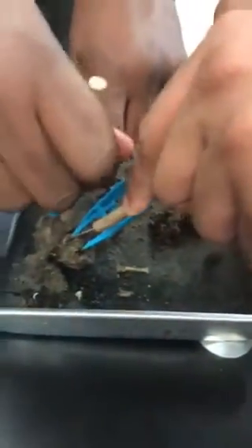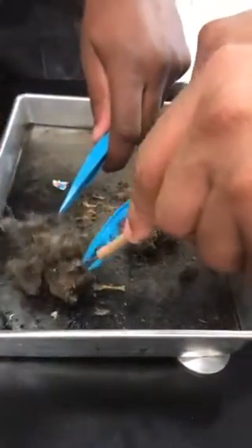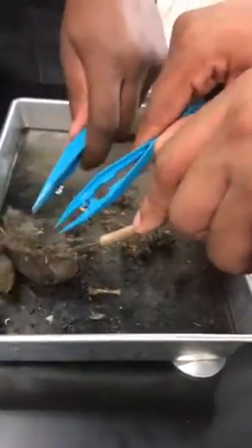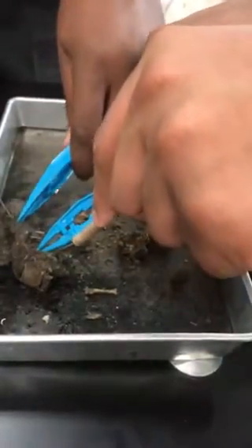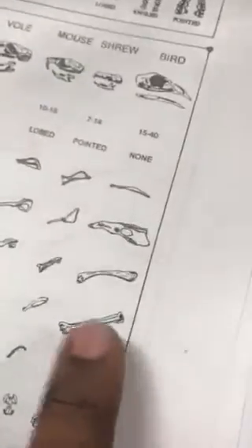Cool. Let's get another piece and identify it. Open this right here. A couple of bones. There's a bone right there. See that bone? I think that bone is right here. Yeah, and what is that actually? A leg? Yes, a leg. So I think you're right, it is a rat.